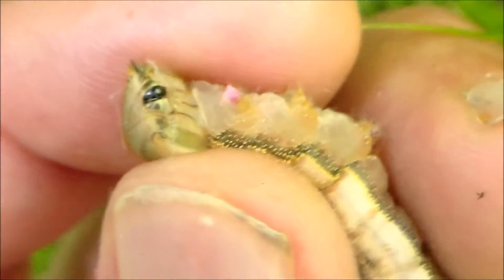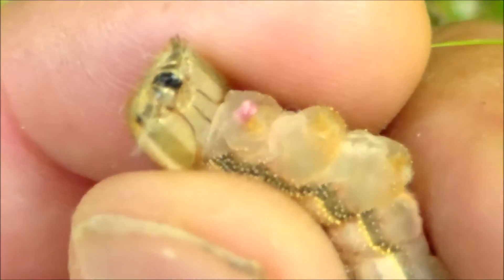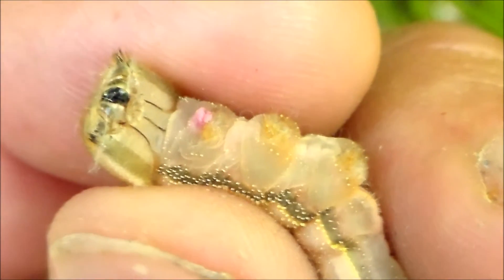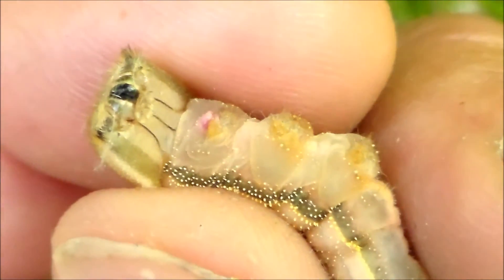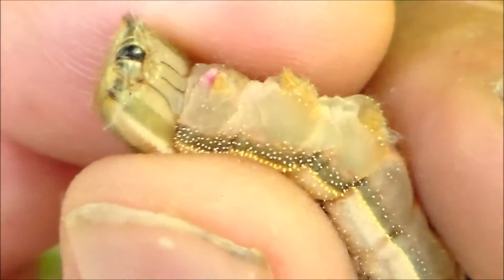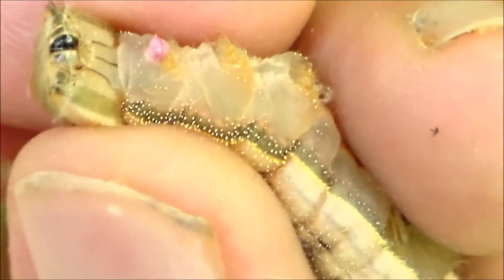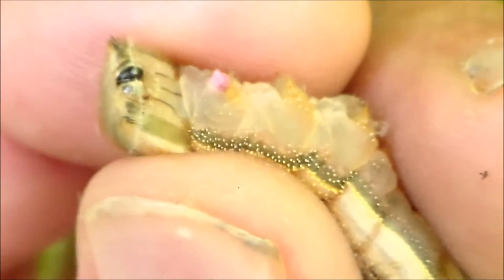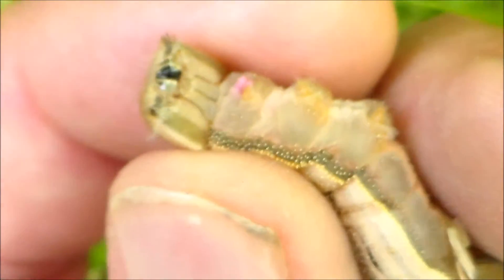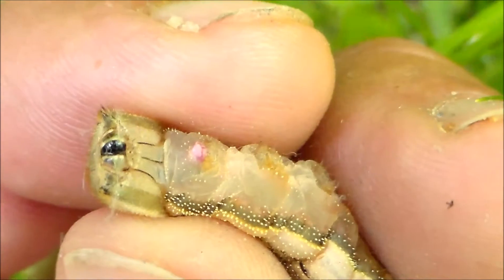This little pink tube or sack — however you want to call it — this is an excellent shot of a larva releasing defensive chemicals. And what these chemicals are, well that's up to us to find out of course. It's yet unknown to science, and it's just intriguing how many larvae have these little hidden defensive mechanisms inside them which have never been investigated.